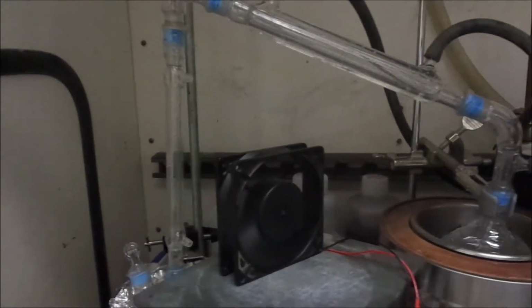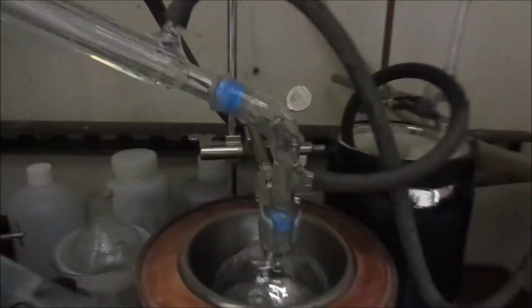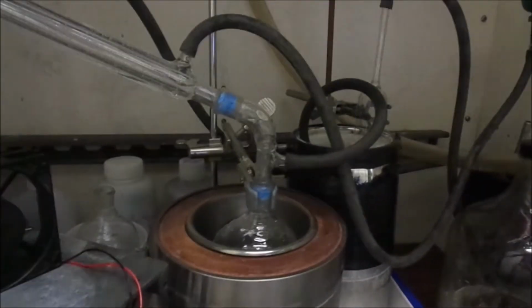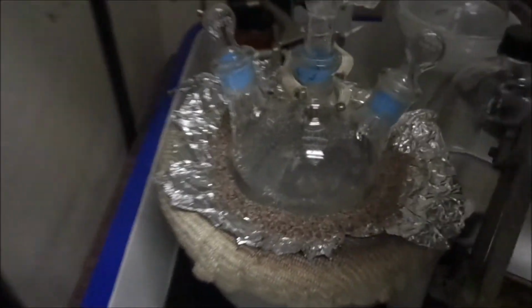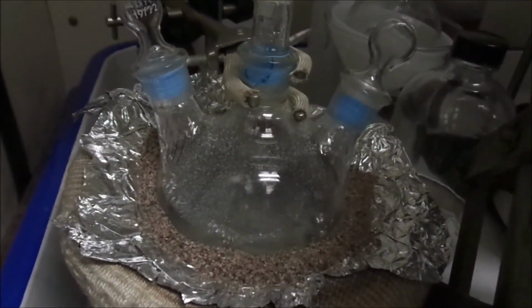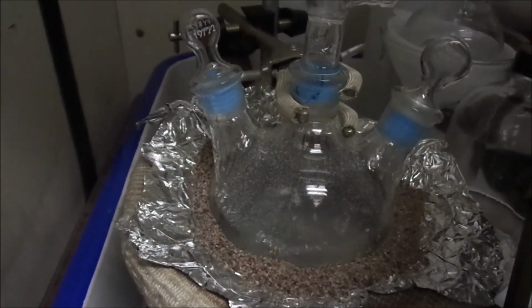So it's the next morning now. Things are going really well. Got a lot of mercury that's built up inside our collection vessel. Got through pretty much most of it here. There's still a good couple hours to go yet, but it's coming along pretty smooth.